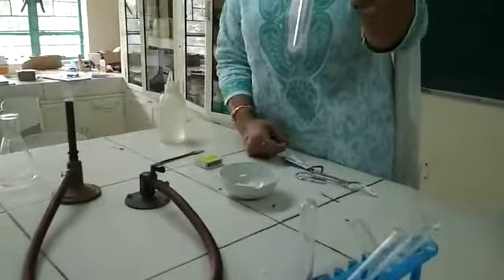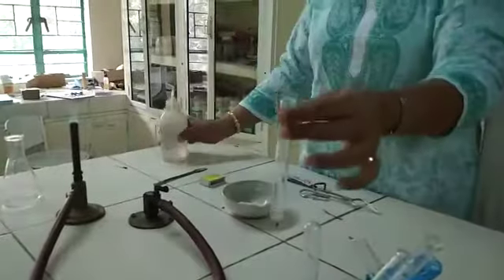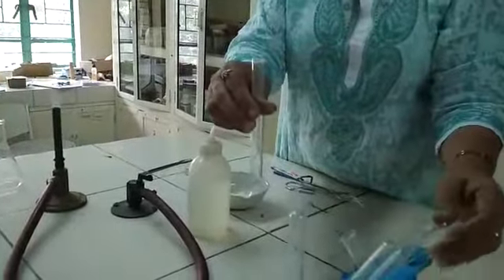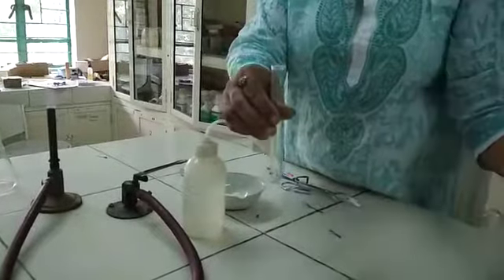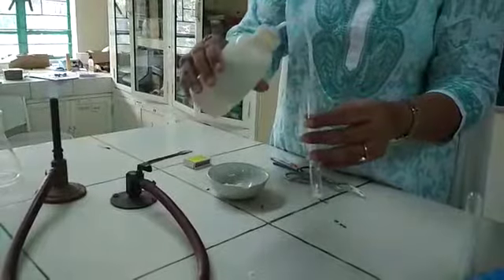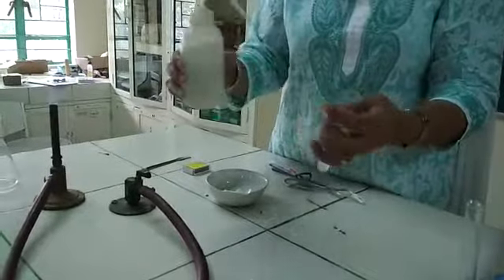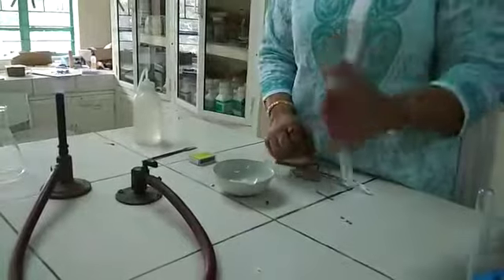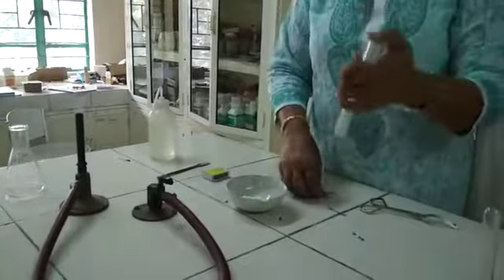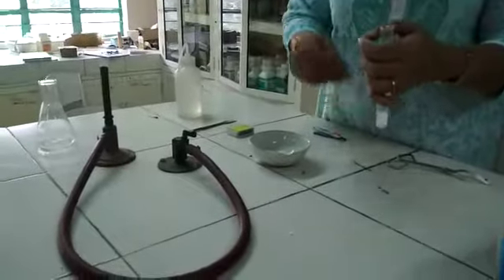So magnesium oxide is a metallic oxide. Let us see whether it is acidic or basic in nature. I have added water to it and shaken it well. Then I put in blue litmus paper and red litmus paper.